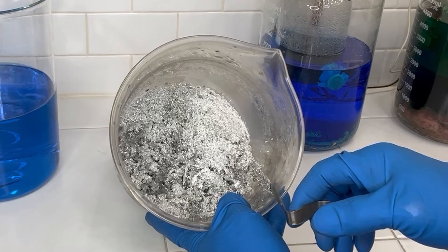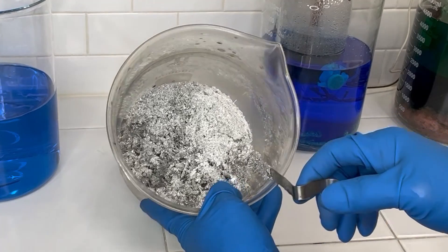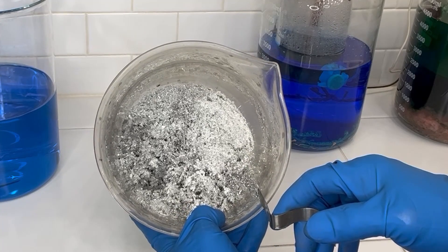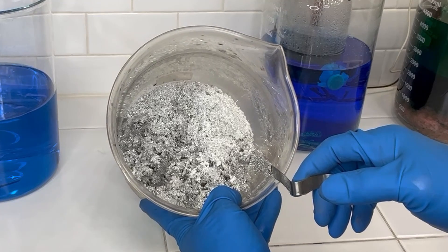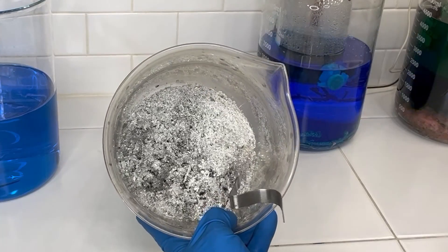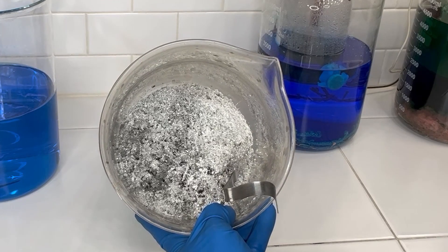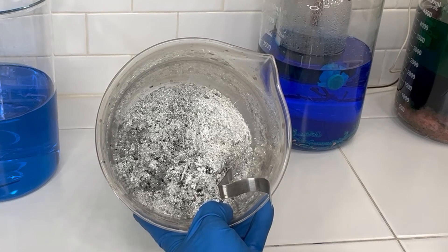You can see quite a bit of pure crystal in there and a layer of copper that probably plated out on the top, so I bet there's still going to be 98% pure here. We'll get some of this out and make sure to get a good sample — we'll mix quite a bit of this together and take two or three samples and take the lowest average. Let's find another beaker to get this silver pulled out.